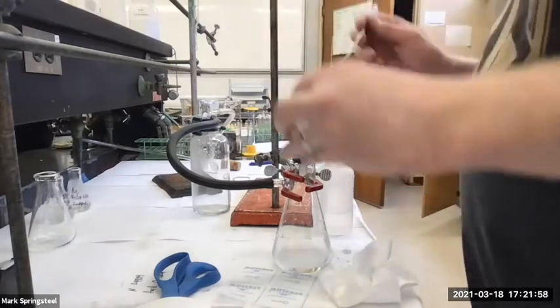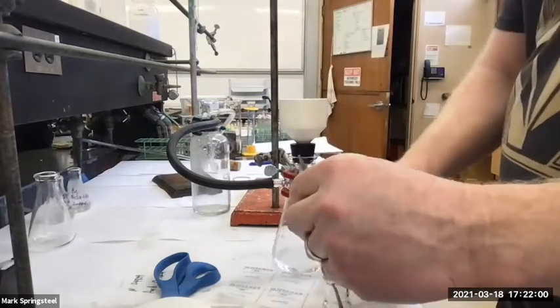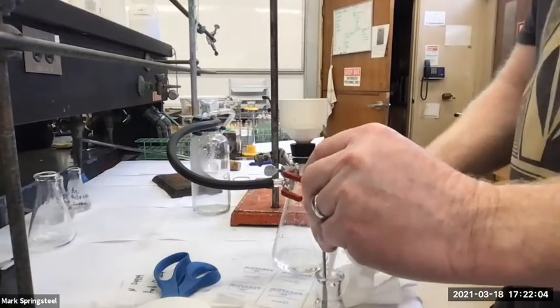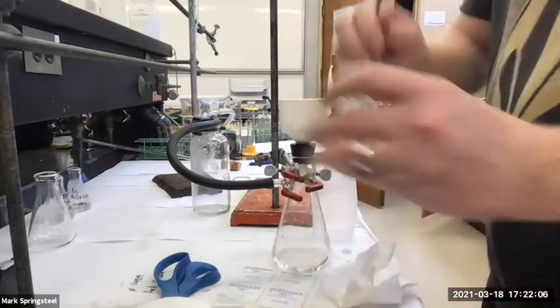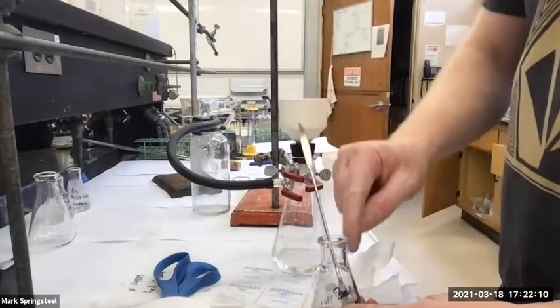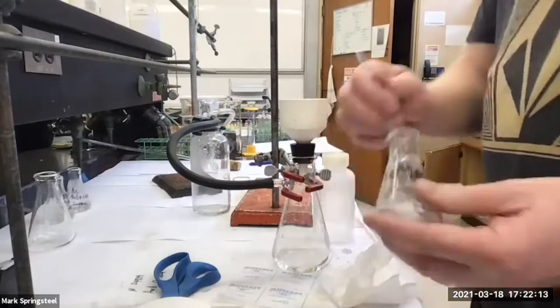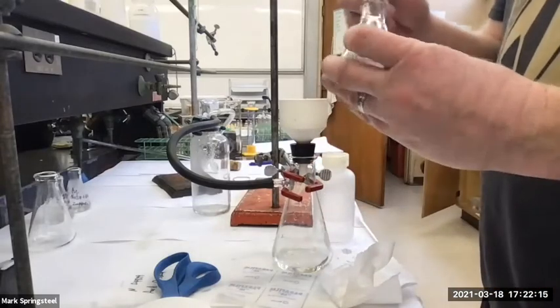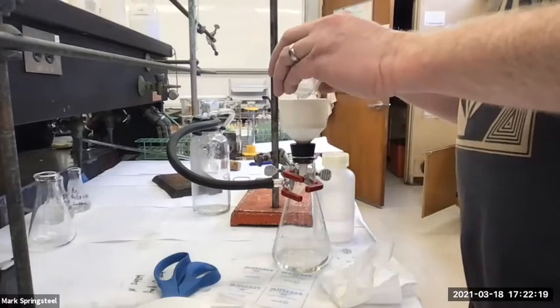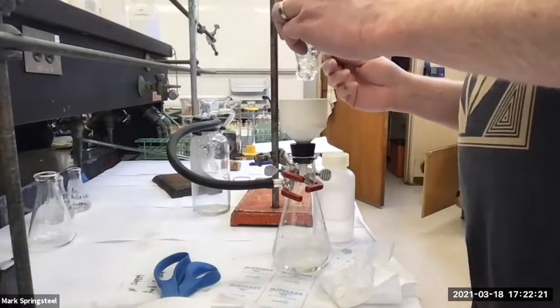And as I said in the crystallization lab, filtrations, and this is not really a crystallization, it's more of a precipitation, but they're never 100% yield, which is okay. If you really wanted to get it all out of here, after I did this, I could rinse this with methylene chloride, put it in a beaker and evaporate it, and then try to crystallize it to purify it or something. I think that's enough though.